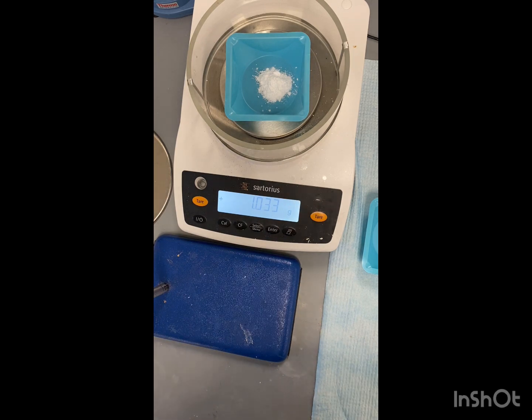Alright, so our final mass is 1.033 grams of our phenylsuccinic acid.